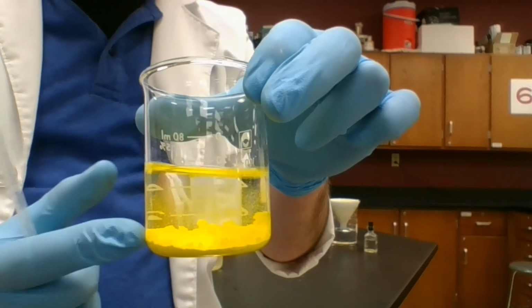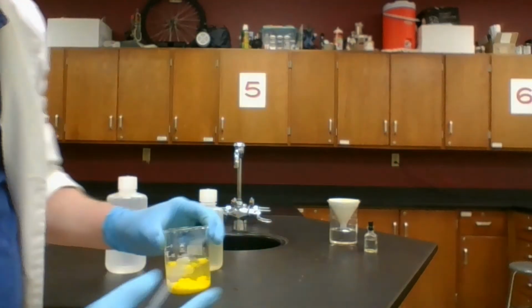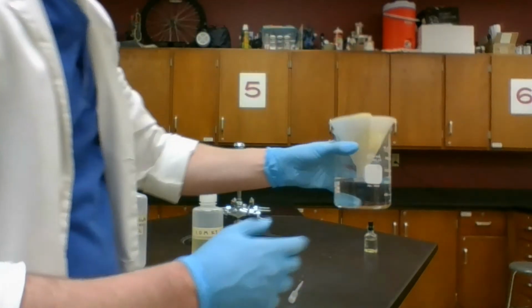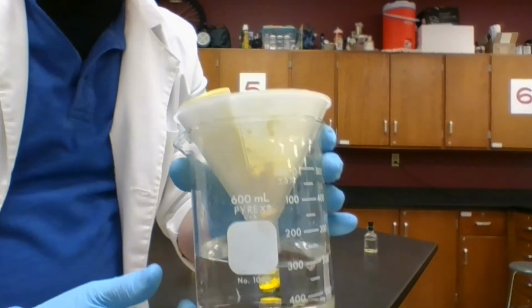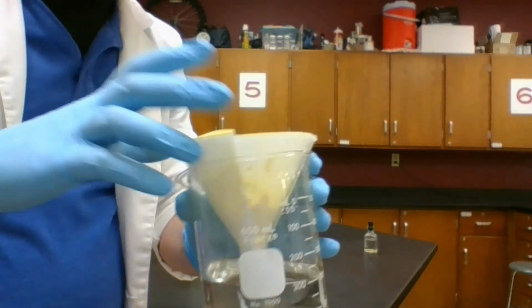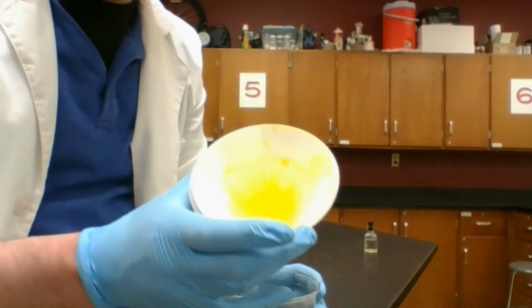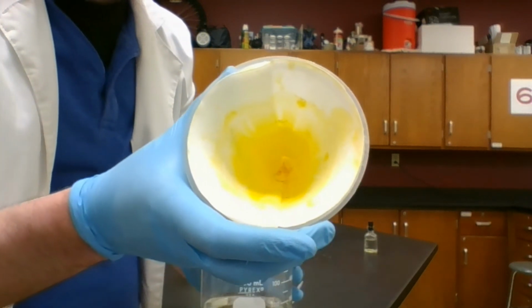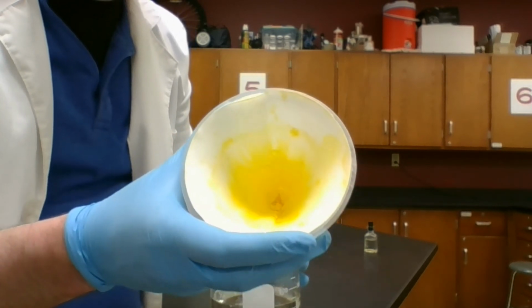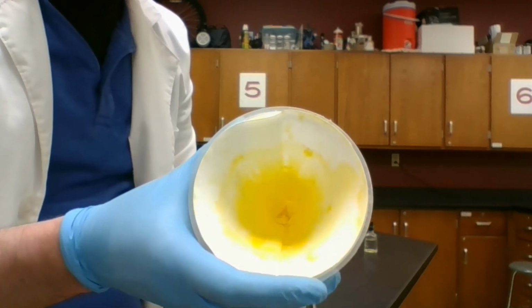Now I can also go and separate and filter this off. I can take the solid and get it out of the liquid by pouring it through a filter like this. I've been doing this with a couple other samples I did in class. So I've got this liquid down here that is kind of separating out on the top, and I've also got filter paper, and that is my chemical solid that I've made, my new substance, my product, which is in this case lead iodide.